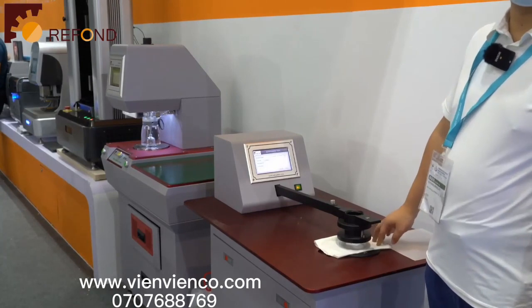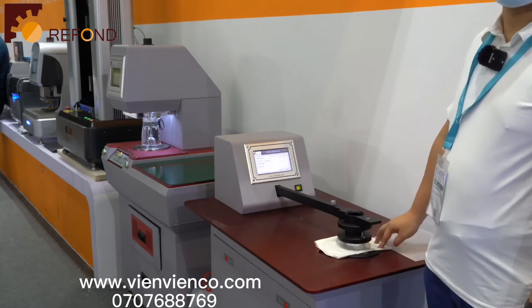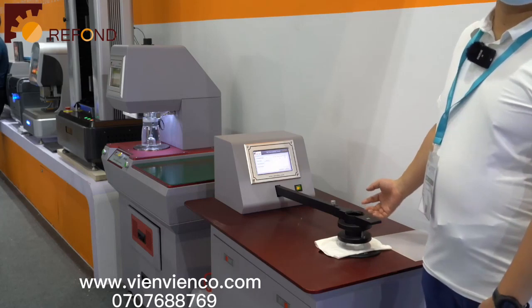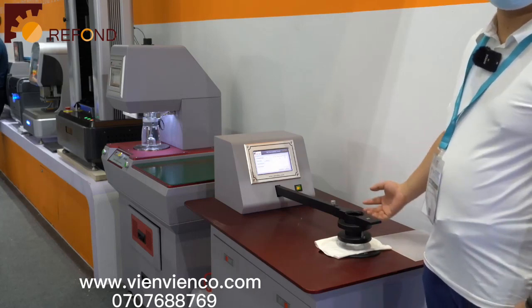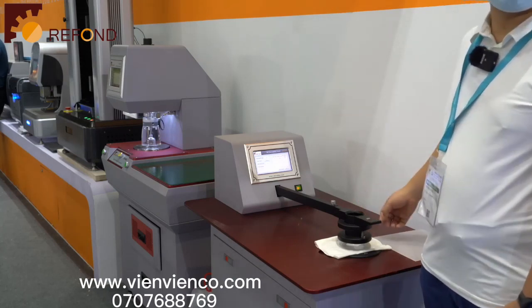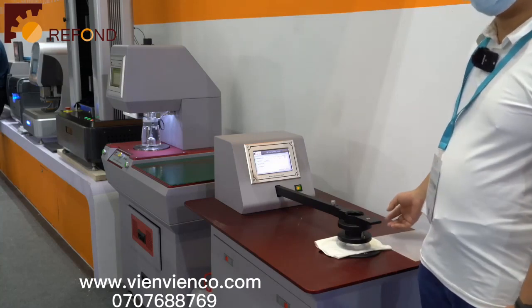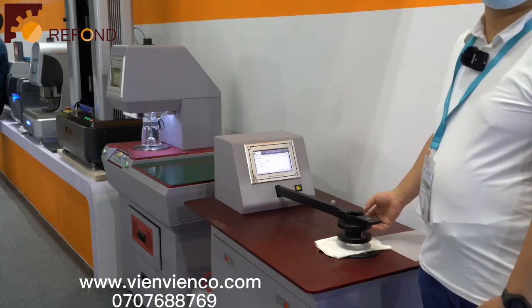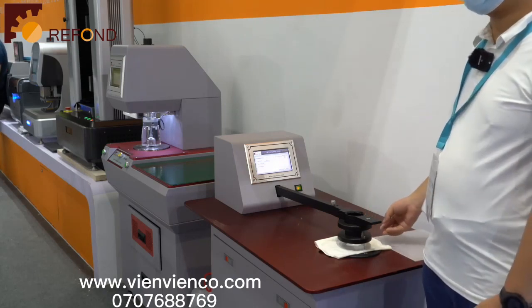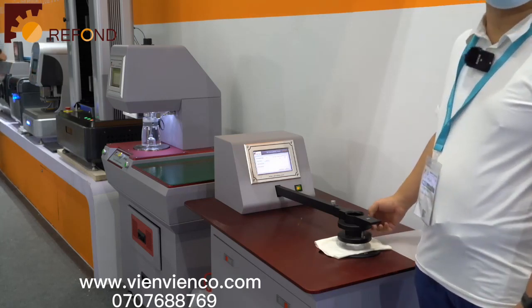The most important innovation for our new machine is that you can use an external calibrated airflow sensor or an airflow meter to calibrate the airflow for this machine. This produces better traceability than the traditional method for calibrating. The traditional method requires a different set of plates, which is labor intensive, and also it cannot provide a lot of traceability. Now we can use flow rate meters to calibrate this machine.